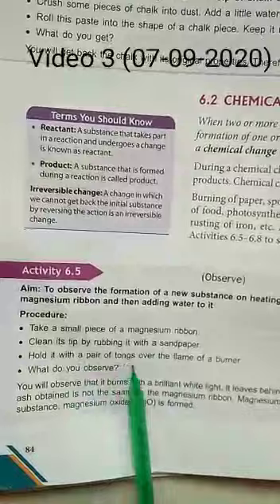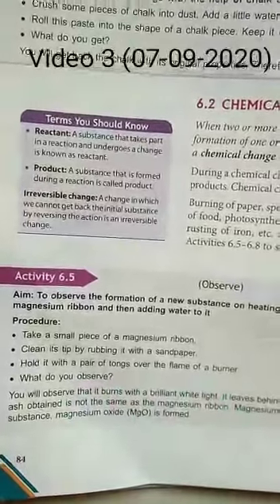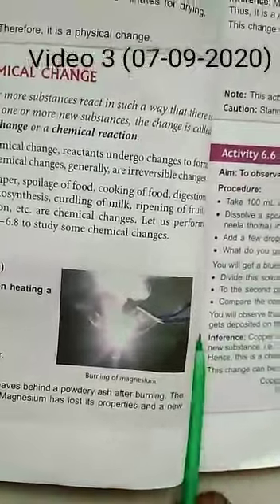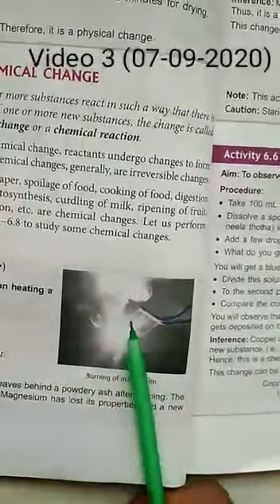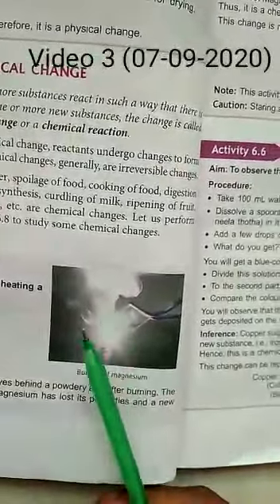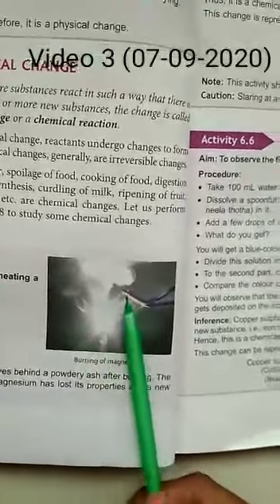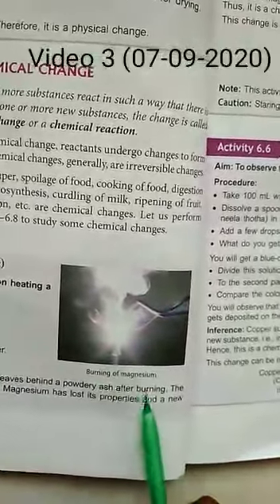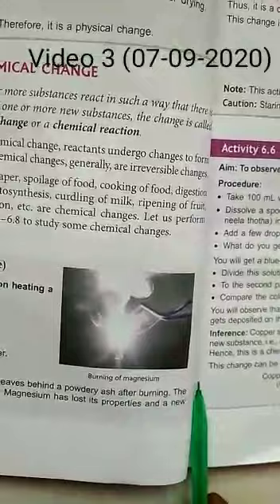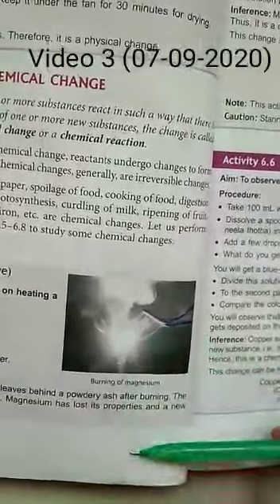Hold it with a pair of tongs over the flame of a burner. What will you observe? It will start burning in the presence of air. You will observe that it burns with a brilliant white light, leaving a white powdery ash that falls down.